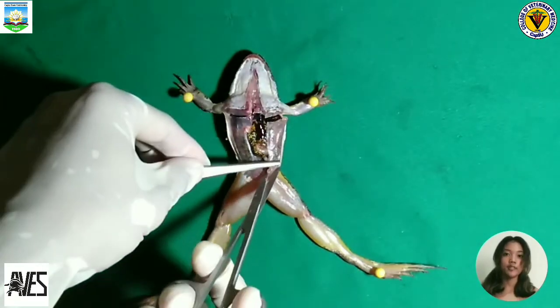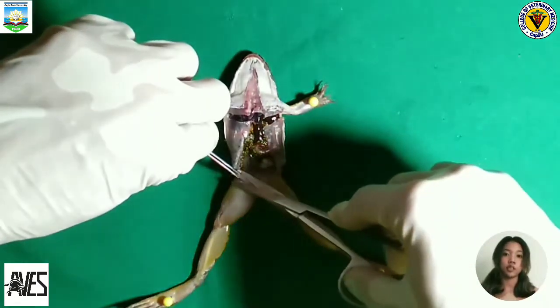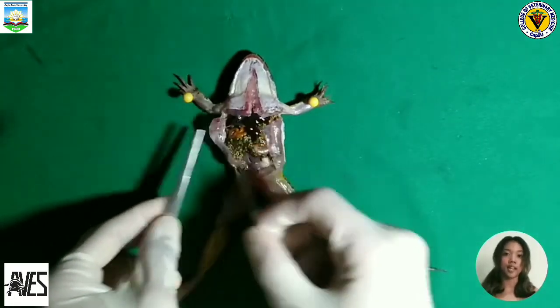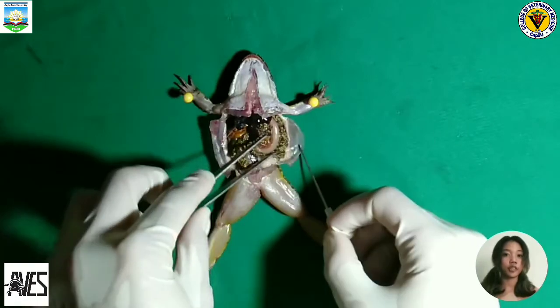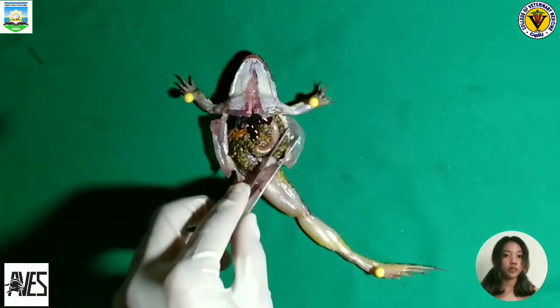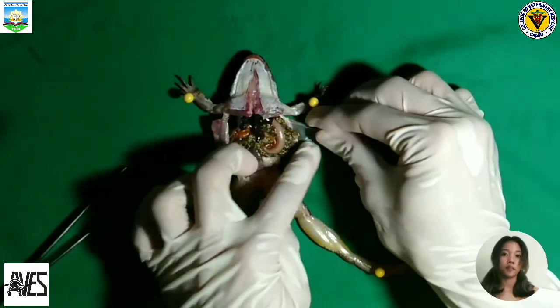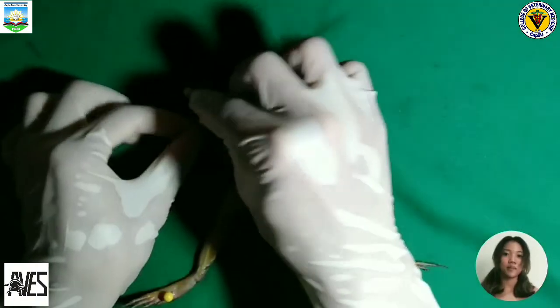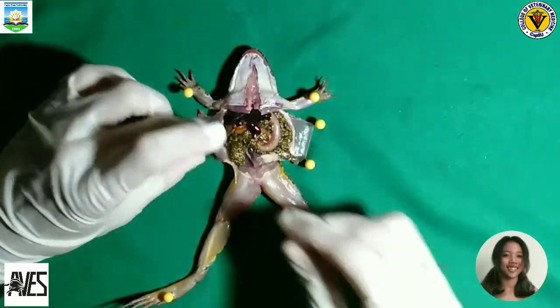When our scissors reach the point just below the frog's neck, we need to cut far enough. Next, using the scissors, make a horizontal incision through the muscle between both the front legs and above the back legs to finish opening up the frog's body cavity, therefore exposing the abdominal region. We use the forceps to hold the muscle flaps while separating the muscle from the tissue below with the scalpel. Once the muscle flaps have been separated from the underlying tissue, they must be pinned back. This will allow easy access to the frog's internal organs.